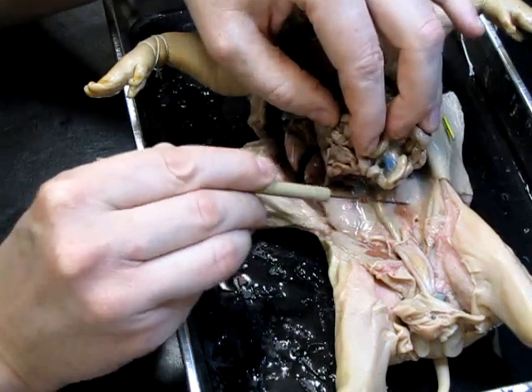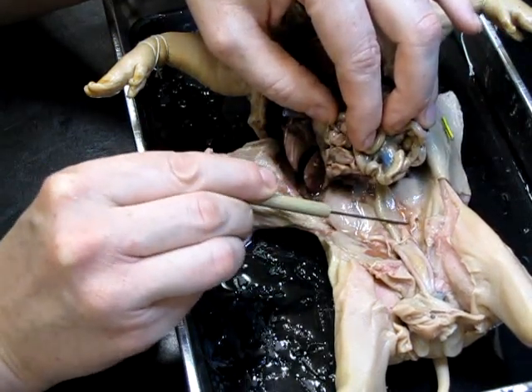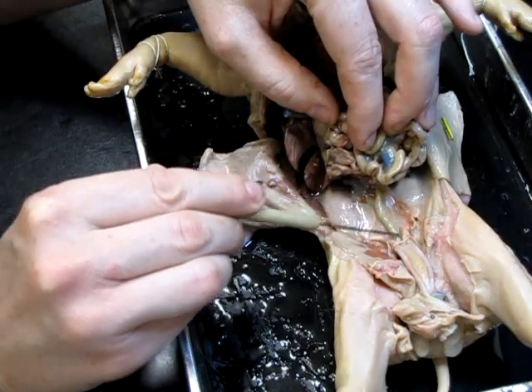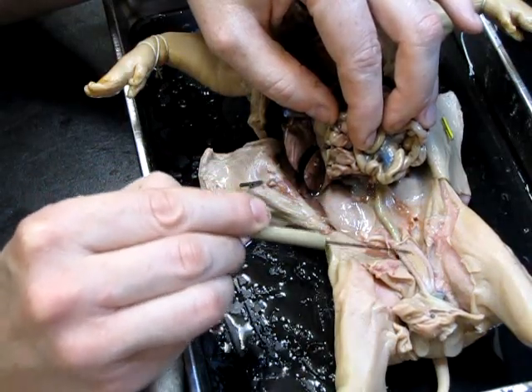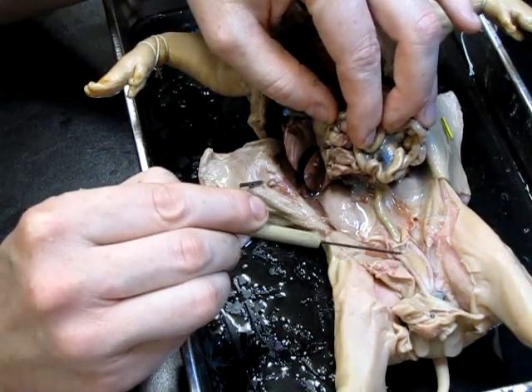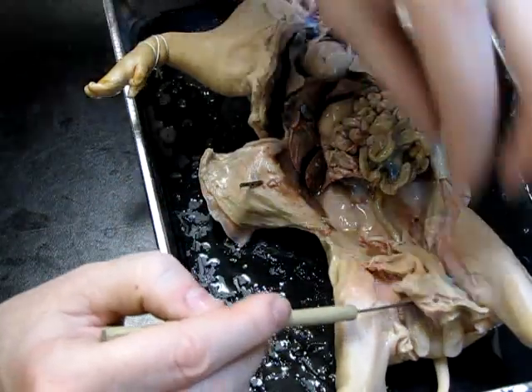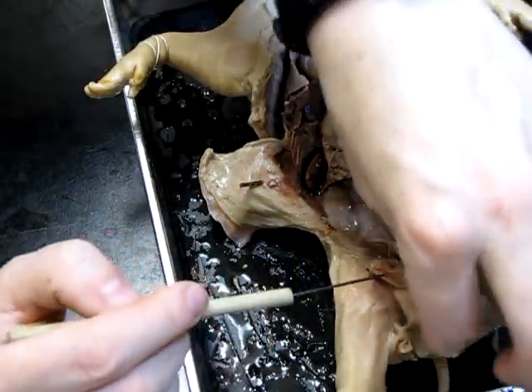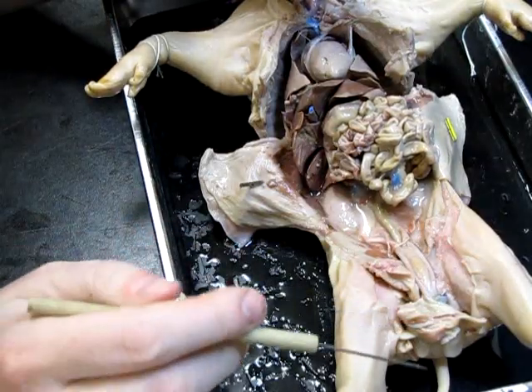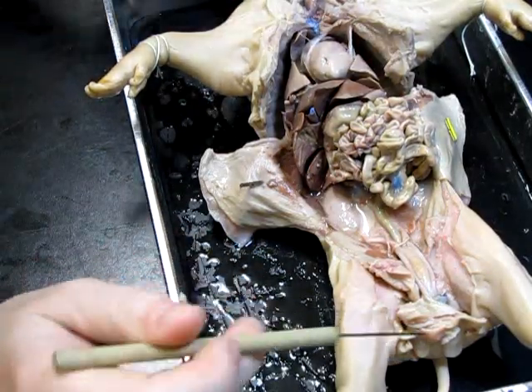I can probably find the other little tube right here, and again that's coming up to the bladder which lies right here. Now I had a little peek and I was able to determine, looking at the external genitalia, that this animal is in fact a male.